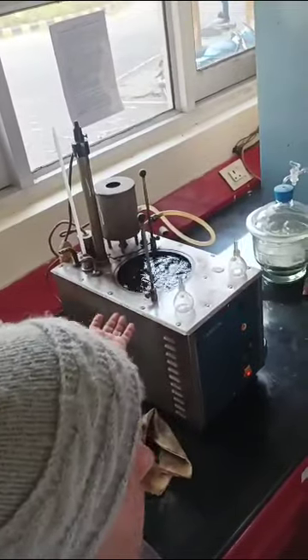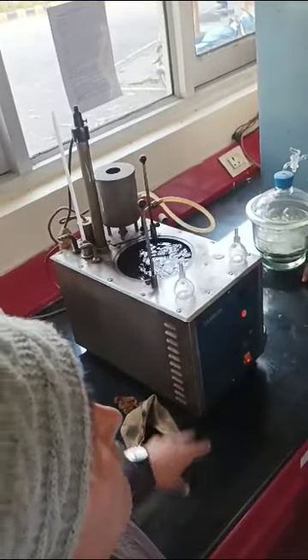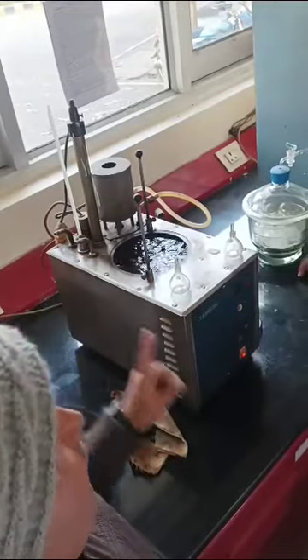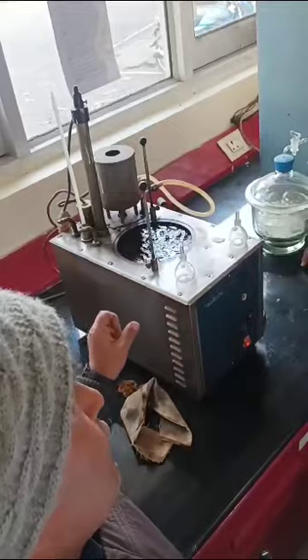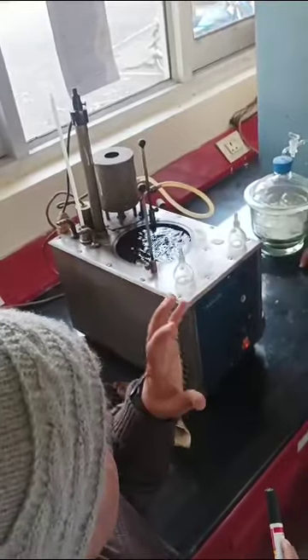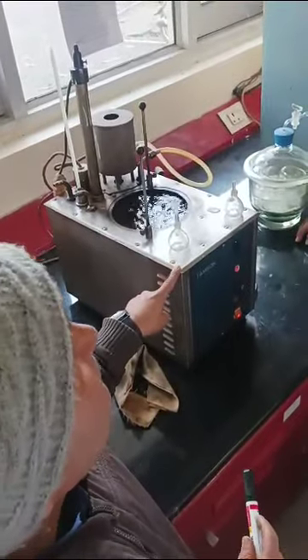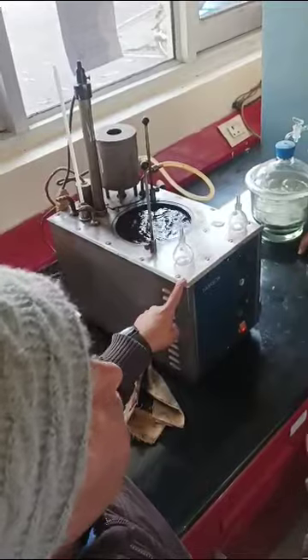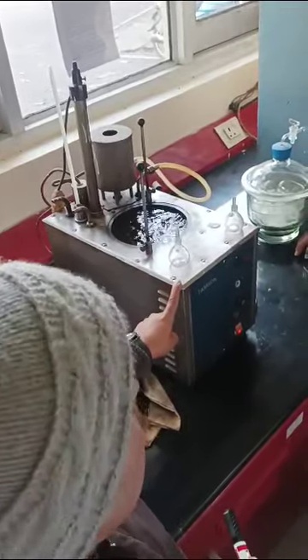And after 30 or 35 minutes, take it out, clean it, and let it come to room temperature. Then again you will take the weight. Then you have the initial weight, you have the water equivalent weight, and you have the weight of the fuel. So the density of that particular fuel is equal to the weight of fuel divided by the water equivalent weight. So you can say it is the density of fuel divided by the density of water. Okay, that is basically the method.